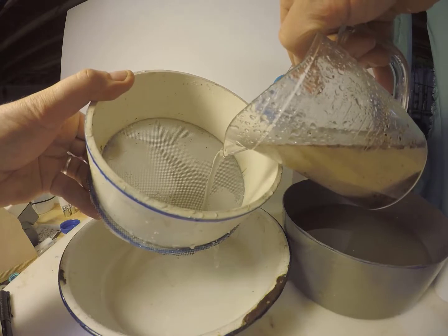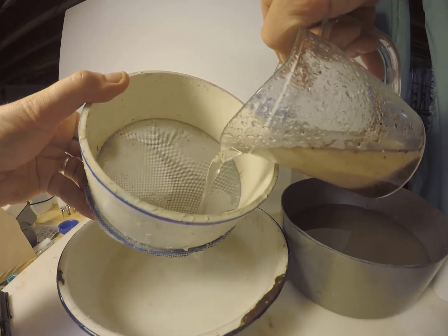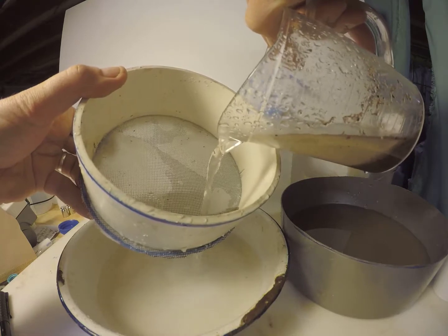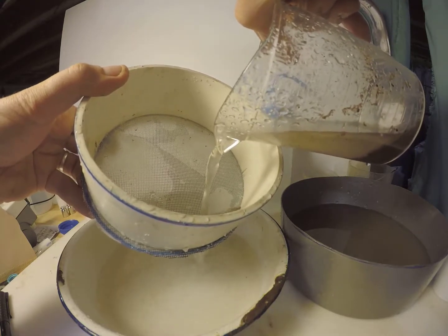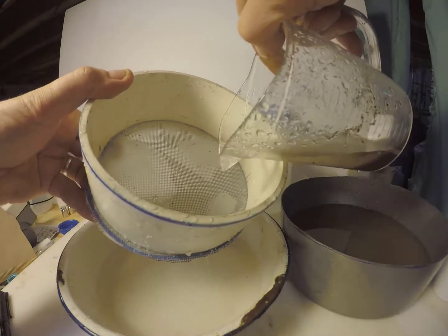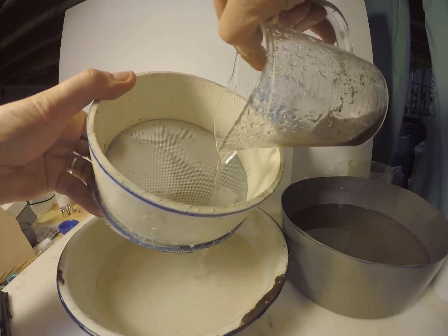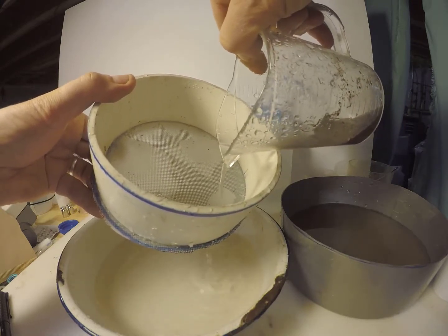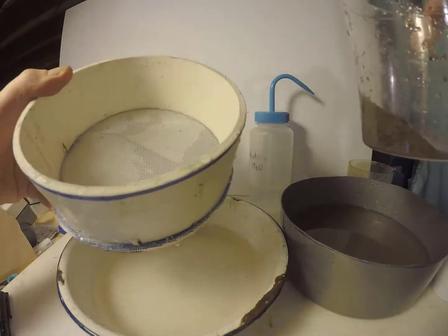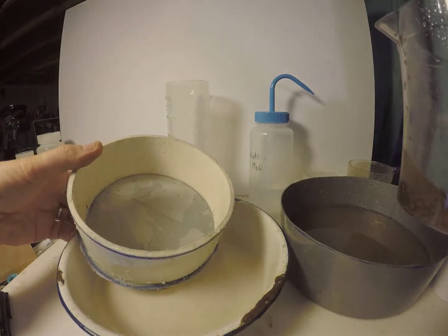Organic matter which is floating in the water or just above the heavier sand is decanted into one corner of the 250 micron sieve. When you are decanting, a slight shake of the cup or measuring cup and being observant will allow you to capture some heavier organic particles without a lot of the sand.